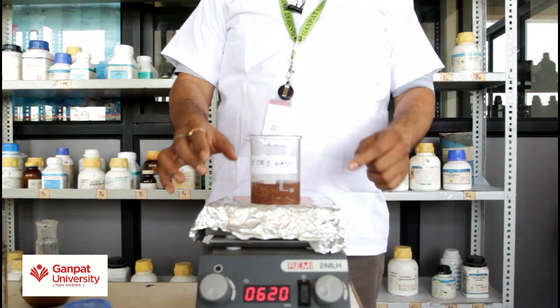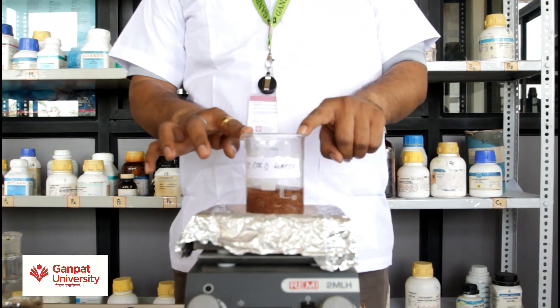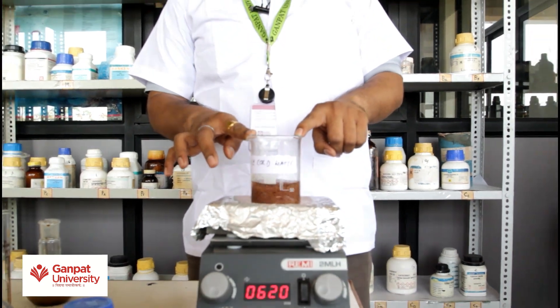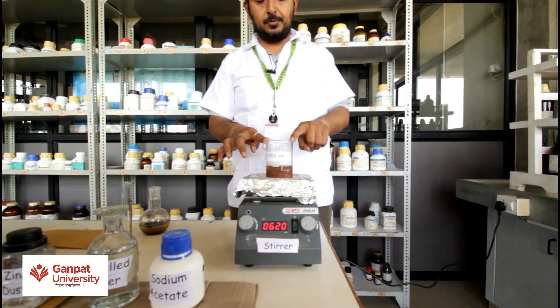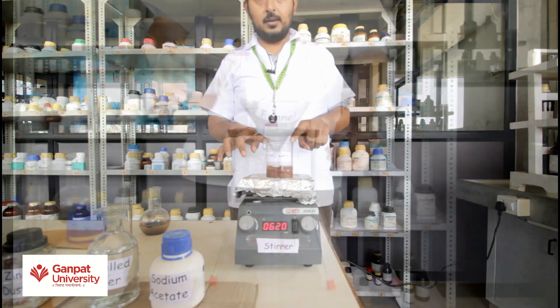Now after 10-15 minutes, slowly the crude product of acetanilide is precipitated out. The color of the precipitate is light brown.